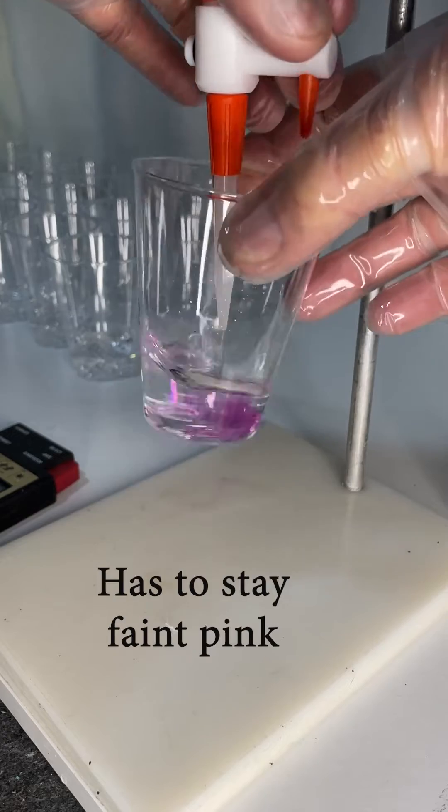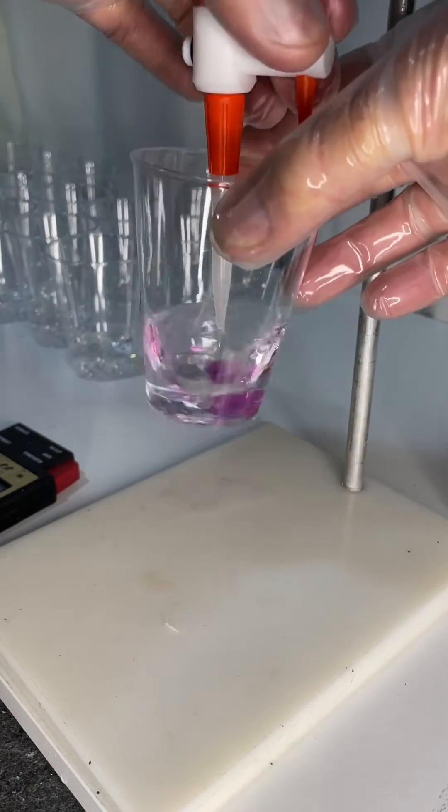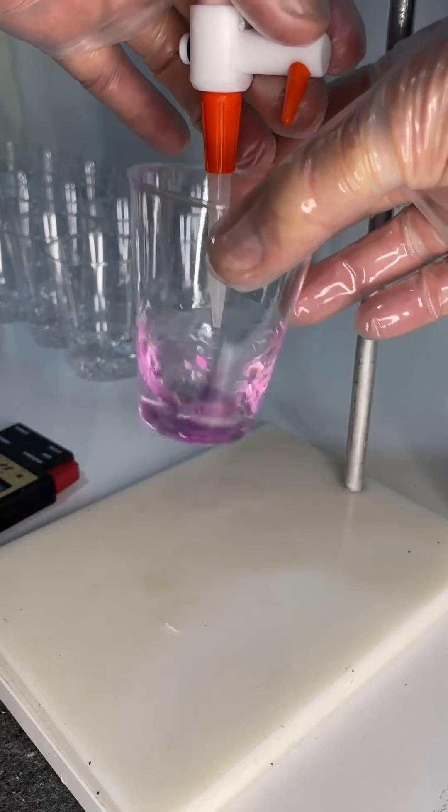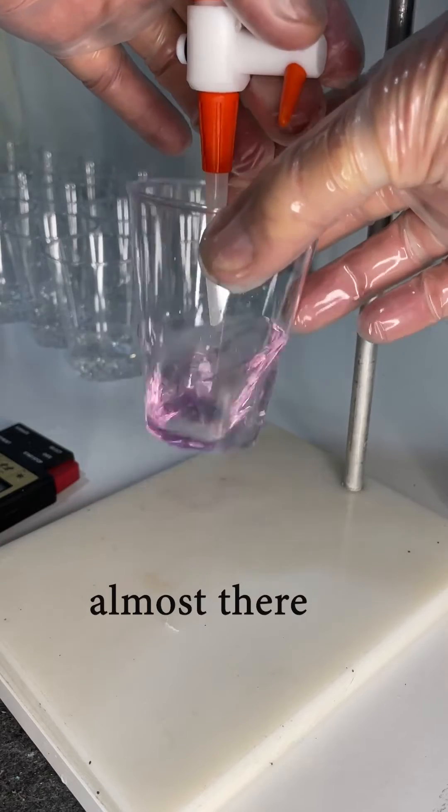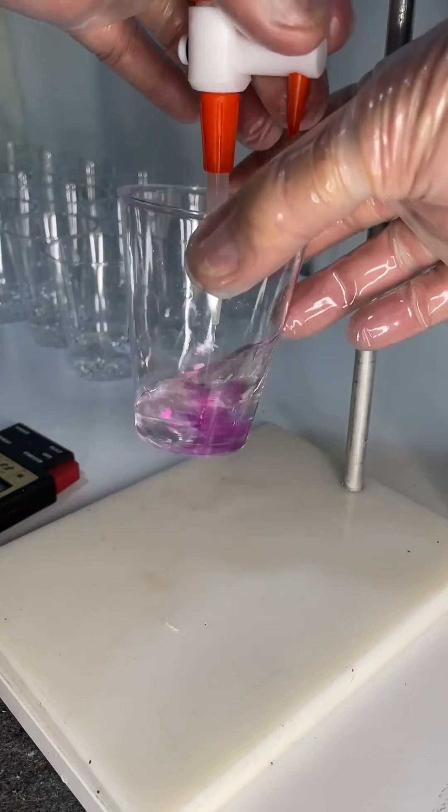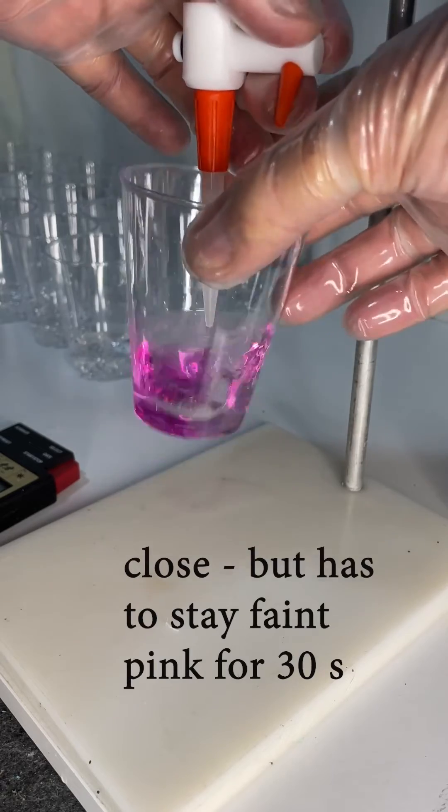You can see here it's not lasting very long. Now I'm titrating soda water in the container so it's basically the weak acid, carbonic acid. It's not quite a distinct endpoint like it would be if it was a strong acid like hydrochloric.